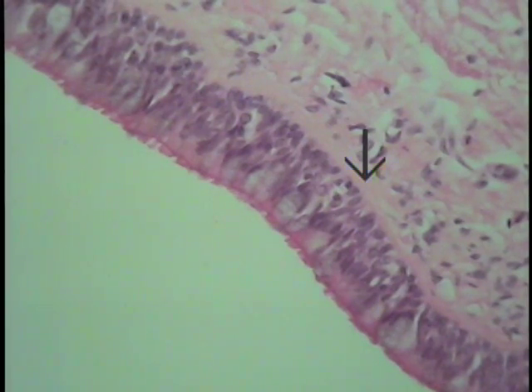Therefore, it is indeed a simple form of epithelium, but because it was confusing to the initial investigators who developed the classification scheme, before it was separated and sort of dissected apart, they assumed that this was a stratified form of epithelium. Then, having discovered that indeed all these cells reside on the basement membrane, sending a process down that touches it, they changed the classification scheme to be pseudostratified columnar. In other words, a falsely stratified columnar epithelium.